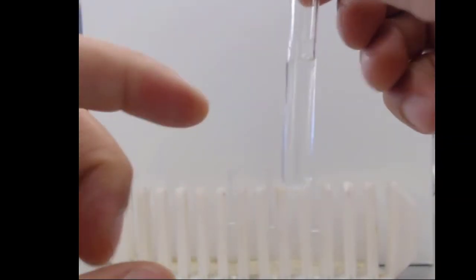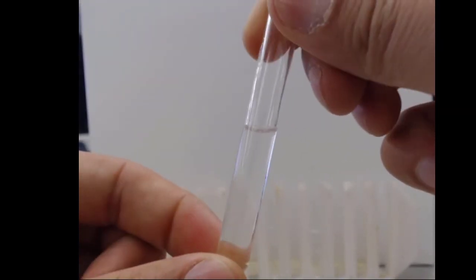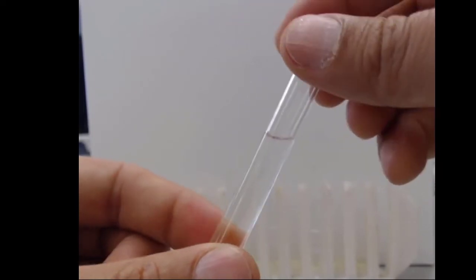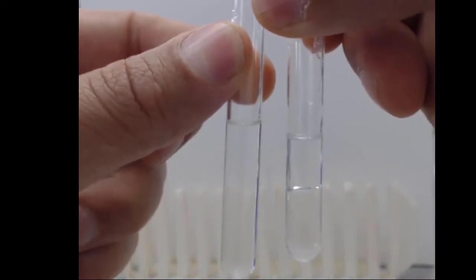We get some cloudiness at the beginning. Doing a little bit of flicking. The ethanol mixes together. I can see a little bit of waviness to it from the mixing and the difference of refractive index between the ethanol and the water, but given a little bit of time, it mixes, and we don't end up with two distinct layers like we did when we had a longer carbon chain.